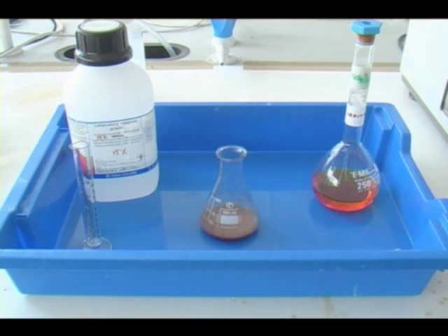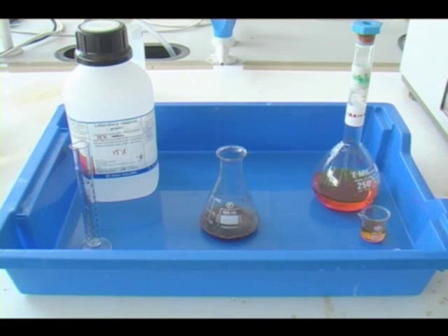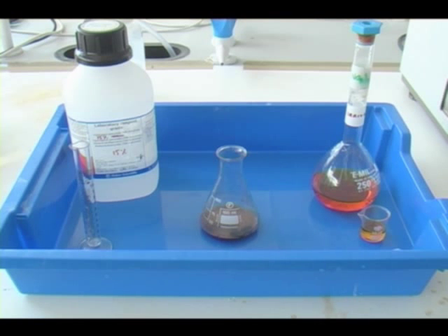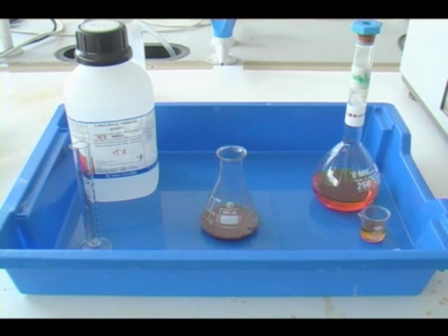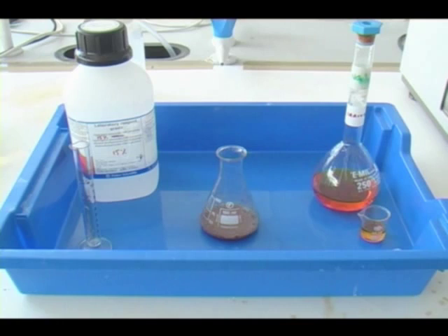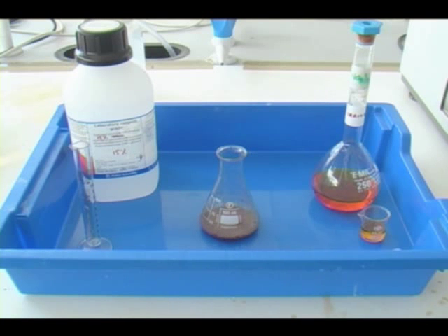As you can see the reaction has started to fizz. This is because the oxygen is being produced much more quickly now. And over time the reaction becomes more vigorous.